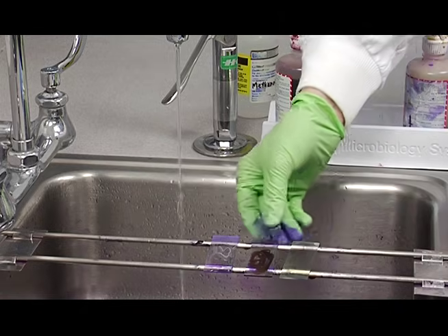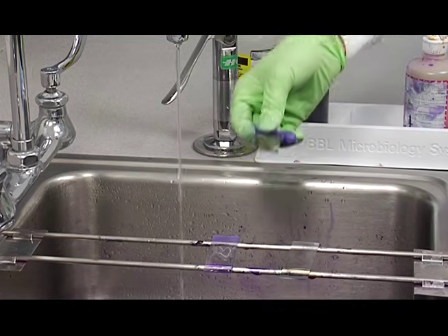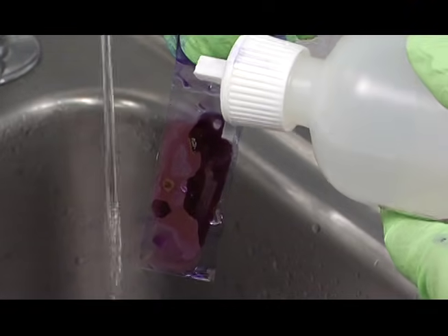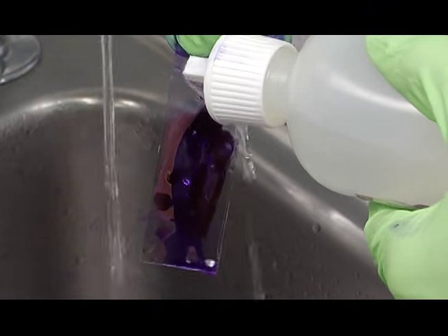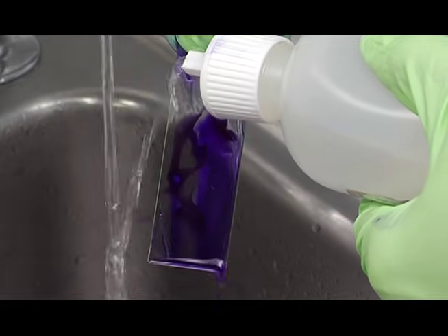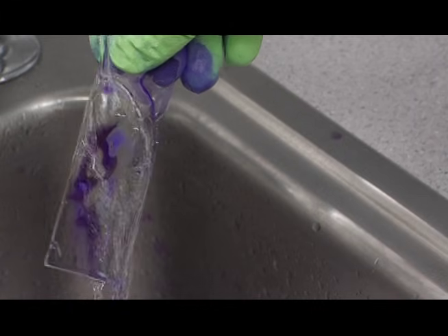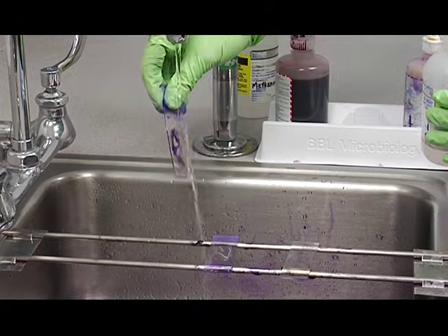And then we'll repeat the same process with the sputum QC. And there you can see the blue stop flowing, and we rinse it off.